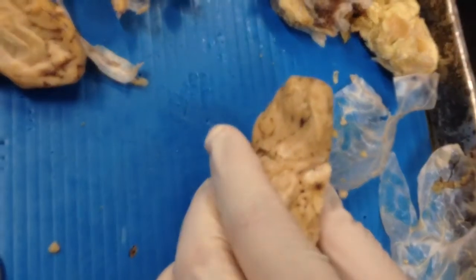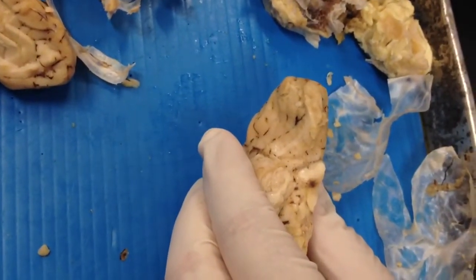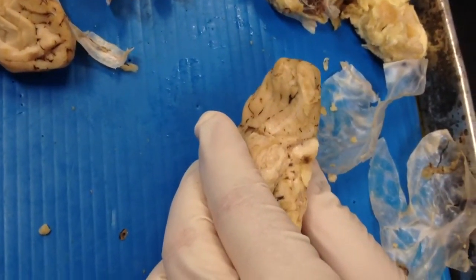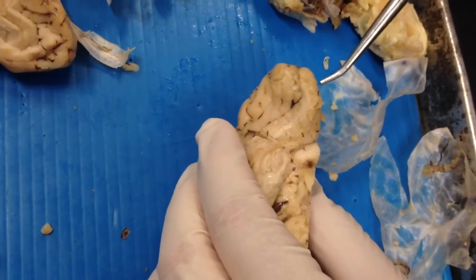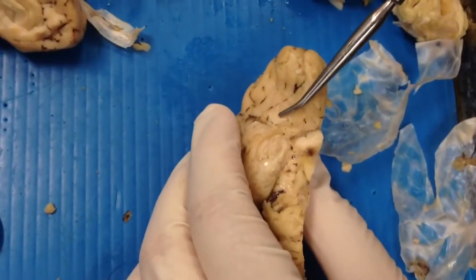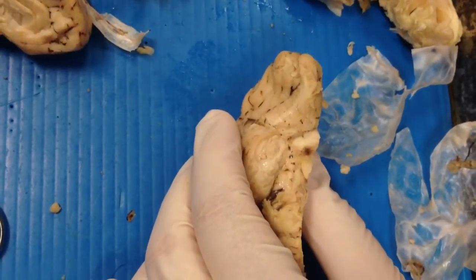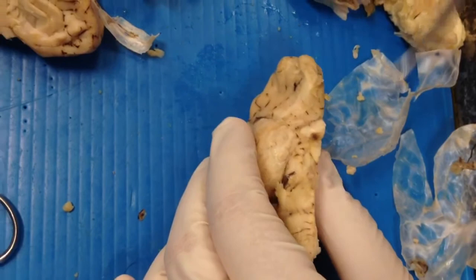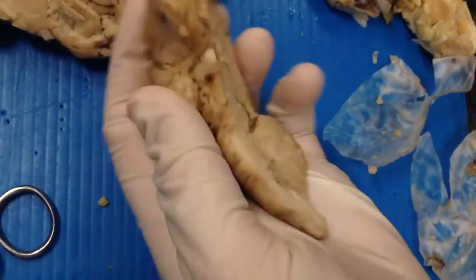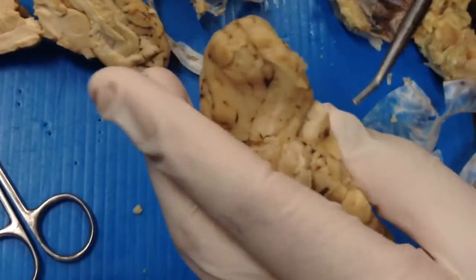The ethmoid bone — we don't have that either. Olfactory tract. Mammillary body — it looks like a tongue.